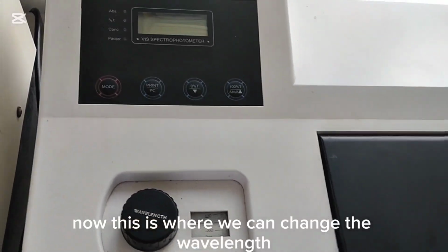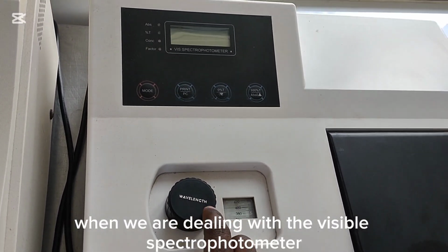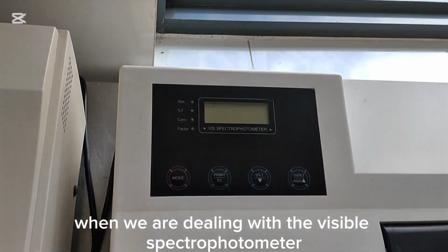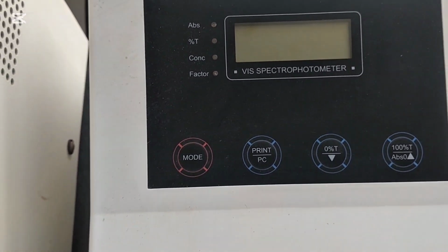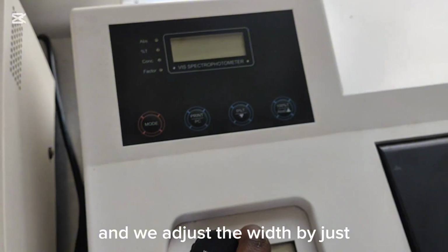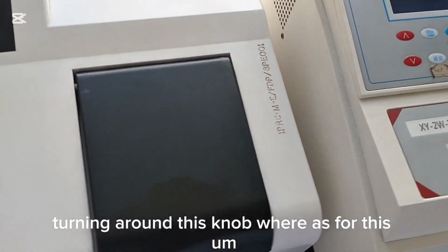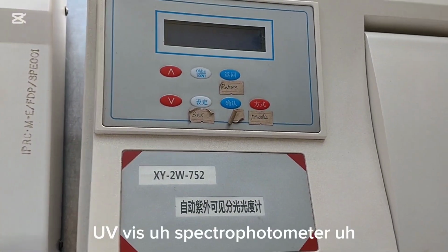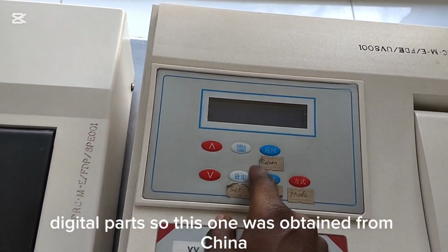This is where we can change the wavelength when we are dealing with the visible spectrophotometer. You can see it is a visible spectrophotometer, and we adjust the wavelength by just turning this knob. Whereas for this UV spectrophotometer, we use the digital parts.